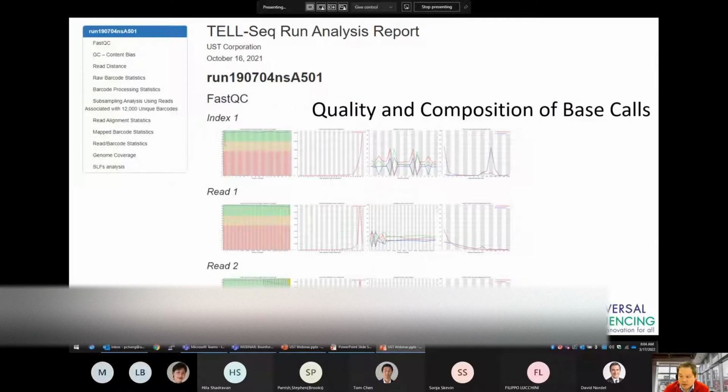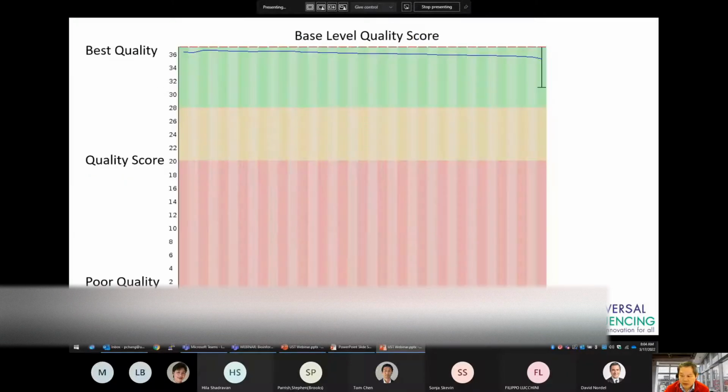First part of the analysis really reports on the quality and composition of the nucleotide base calls for the 3 types of sequences, which we know are index 1, the molecular barcode, read 1, and read 2. The report describes the base quality across each position in the read from start to end.